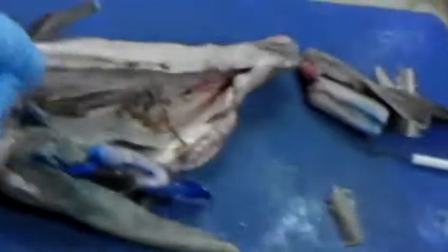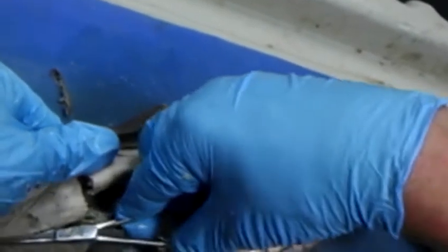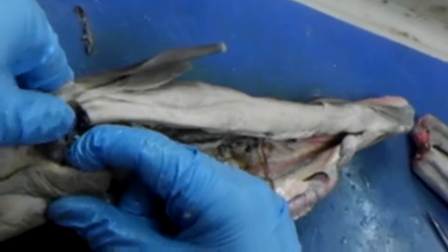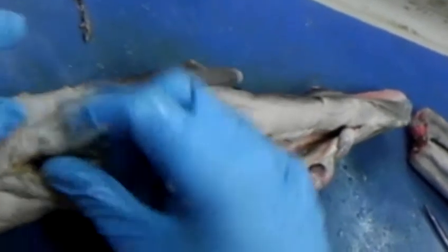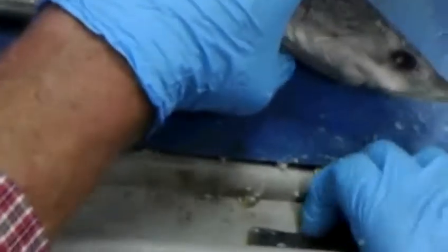Next structures that we need to do, let's go ahead and look at a couple of muscle structures here while we have it, before I get past these. So you're going to have various constrictor muscles. Most of the muscles are all in the body mass, right in the myomeres.